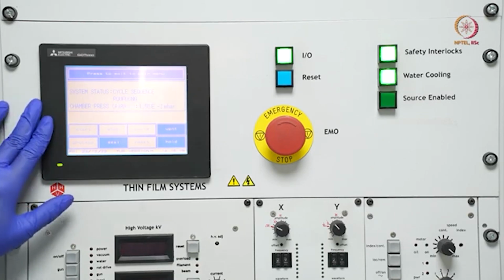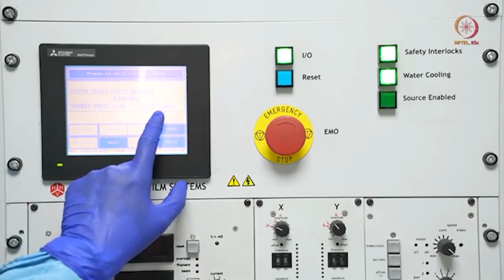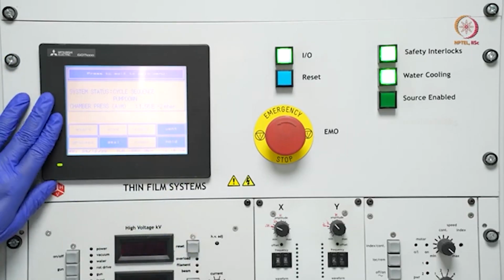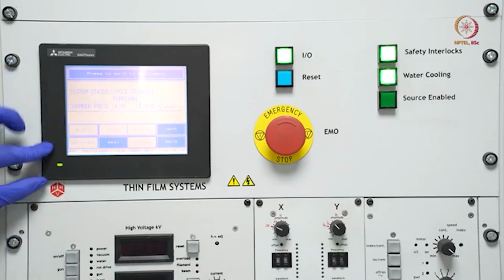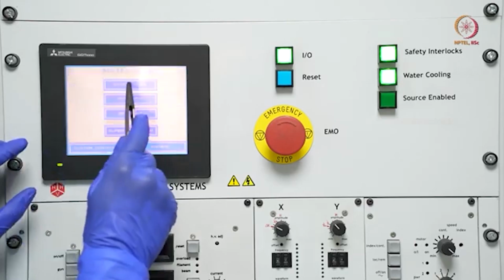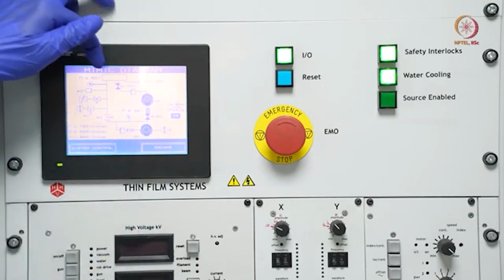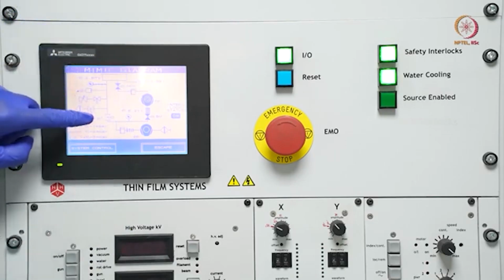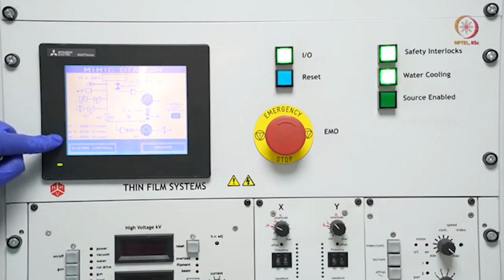So here you can see it is going down, it's -2 now. So we will wait for some more time, it will start fine pumping. Now it has started pumping through the backing line. We can show it. See, now this high vacuum valve is on, so it is through this backing line now, and this roughing line is closed. Okay, and this P3, the penning line, is activated now.